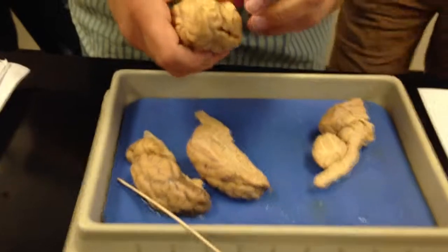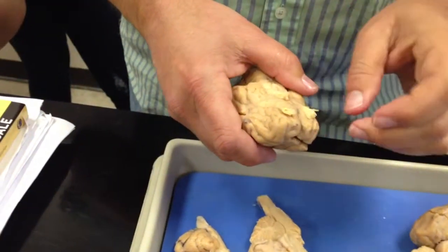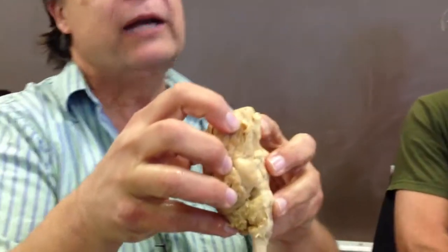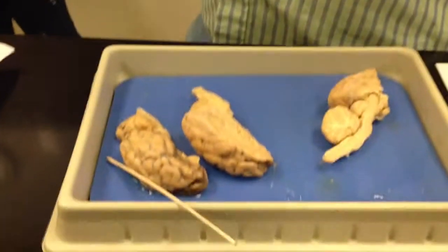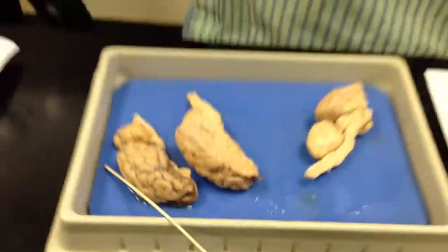And then the olfactory bulbs. You can see these. This is where cranial nerve number 1 is. You see these little guys hanging off the bottom here? If you think of this brain being in the sheep's cranium, those are right over the nasal cavity. The nerves hang down from there into the nasal cavity, the same way that yours do. These are relatively larger on the sheep. They're also on the models, but you'll notice they're much smaller.